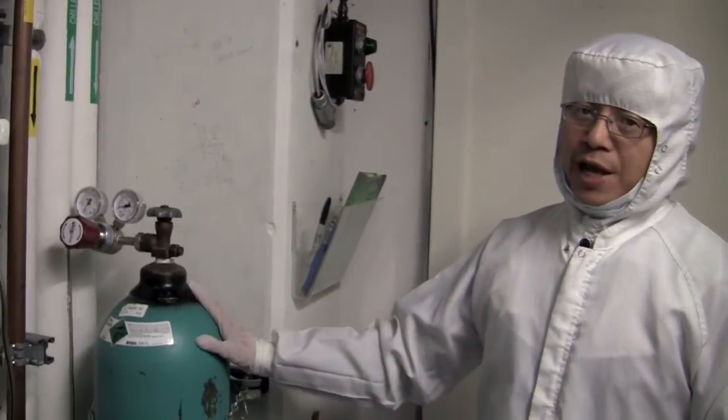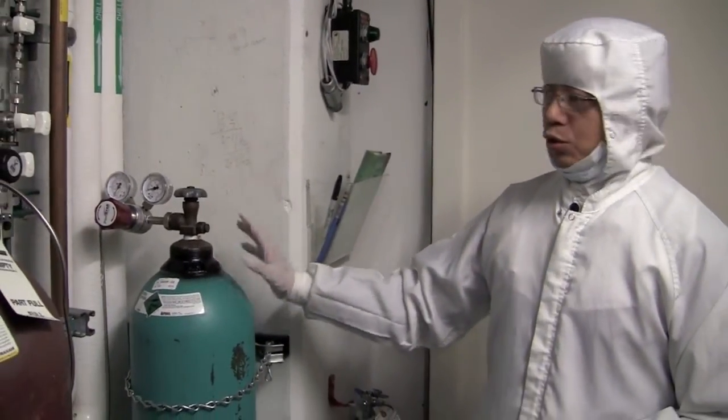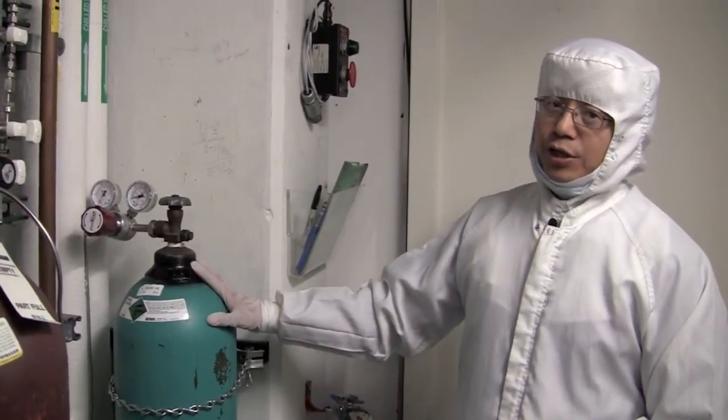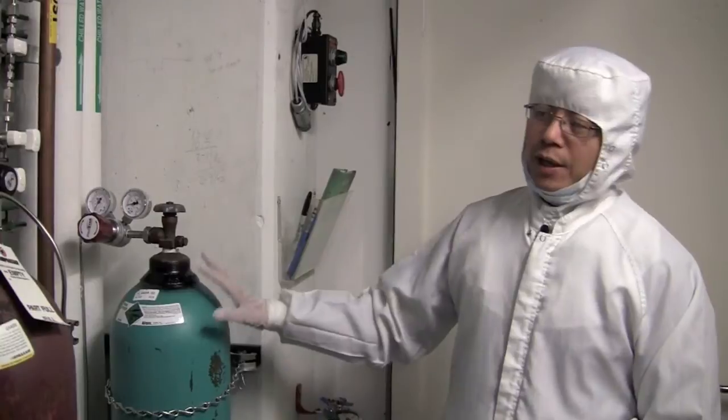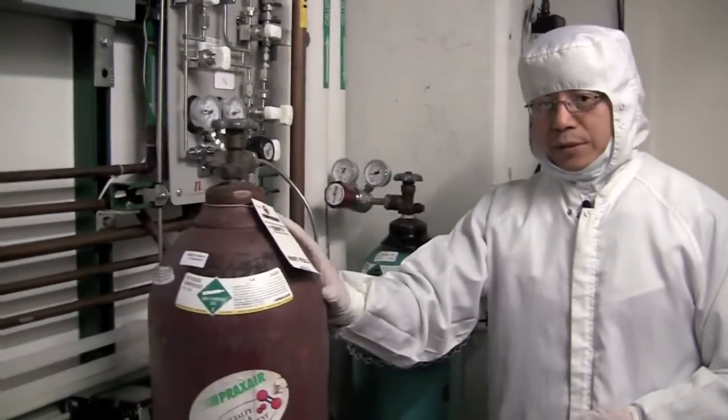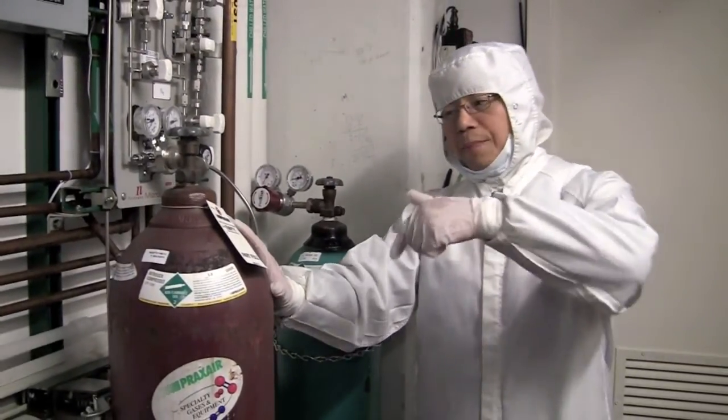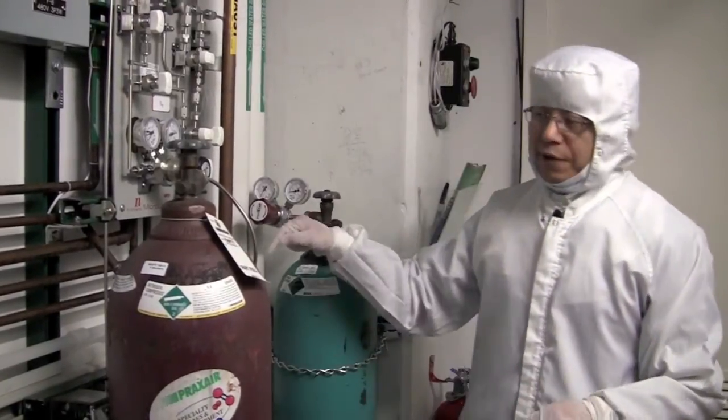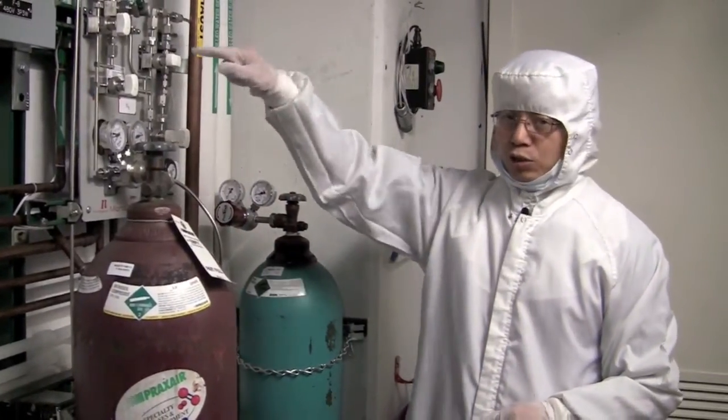Another thing I want to mention is do not open this tank. This tank is used only when this tank is empty. So during swapping this empty bottle with another full bottle, we still have nitrogen flowing into the chamber.